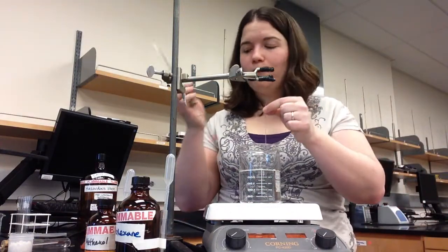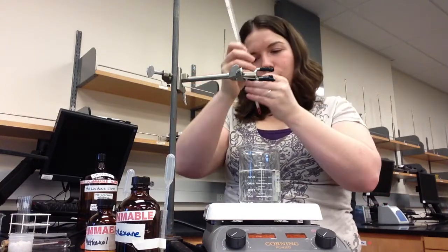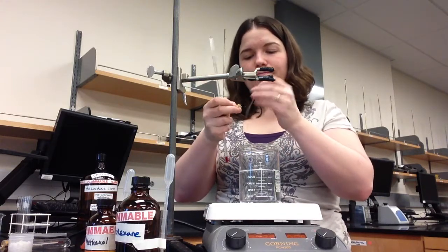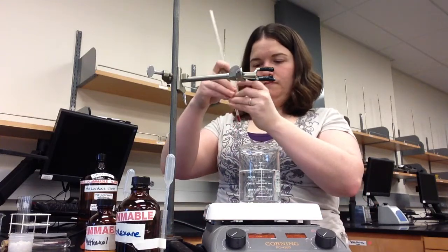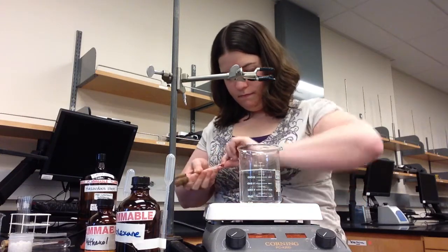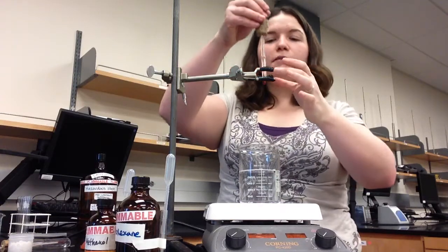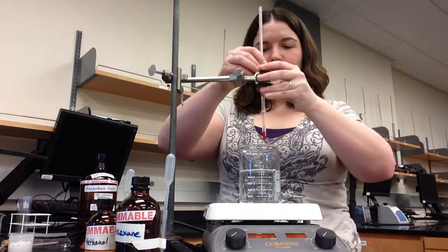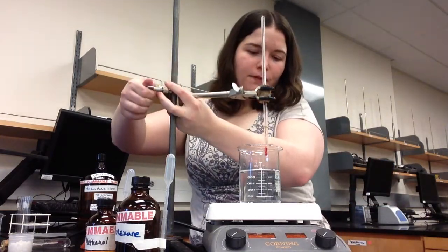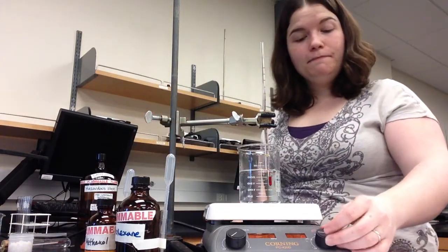Because we are measuring the melting point, we need a thermometer. I have a thermometer and a ventilated cork ready to go. And I'm going to use another rubber band to hold the capillary tube to the thermometer. Okay. So now I can put the capillary tube attached to the thermometer into the test tube clamp. And then I will lower the thermometer and my unknown solid into the beaker. I can then turn on the hot plate.